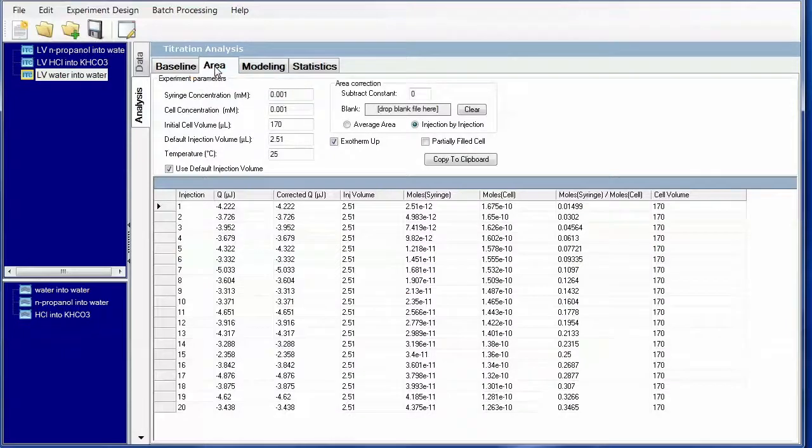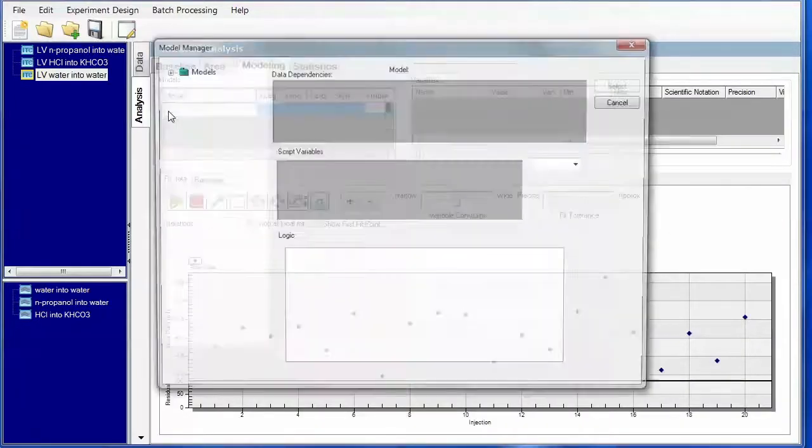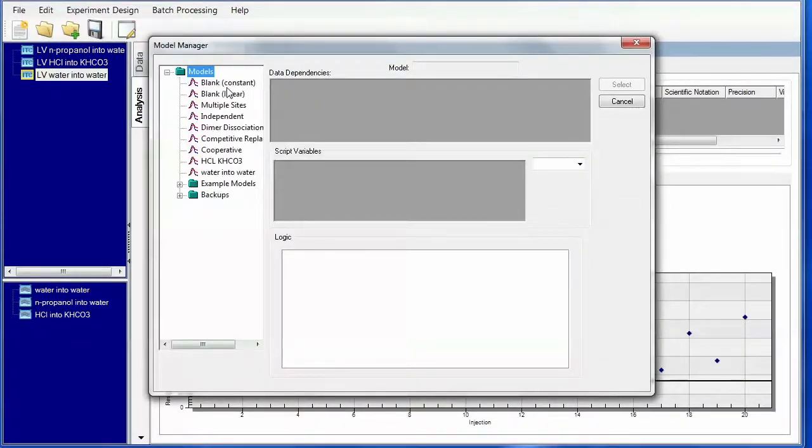Next step is to go to the area tab. We will need concentrations in both the syringe and cell. These are dummy concentrations and won't be used in the fitting, but they are necessary in order to proceed to the next tab, modeling. The appropriate model for the water into water is the blank constant.